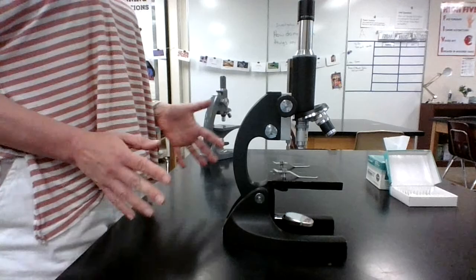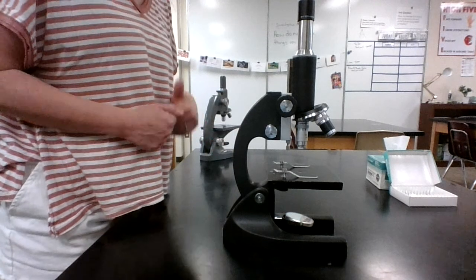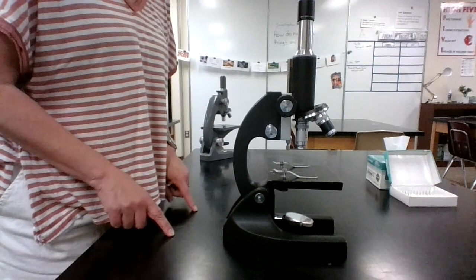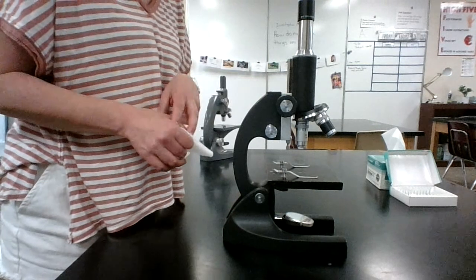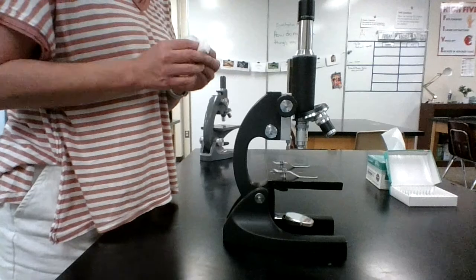All right, let's look at looking through the microscope. First thing your teacher may tell you to do is clean the lenses. We won't always tell you to do that, but if we do, it's important to only use the supplies we provide. We have lens wipes, and you can use those. You can't use Kleenex. You can't use paper towels. You can't use your shirt. Only the lens wipes you've been given.